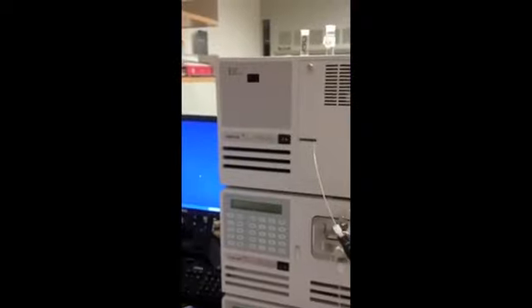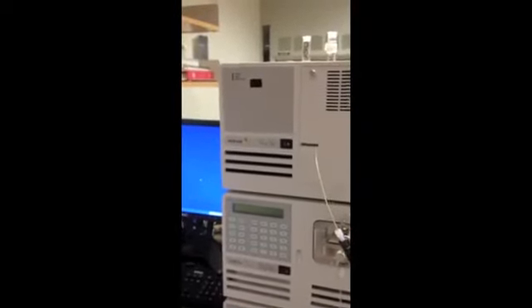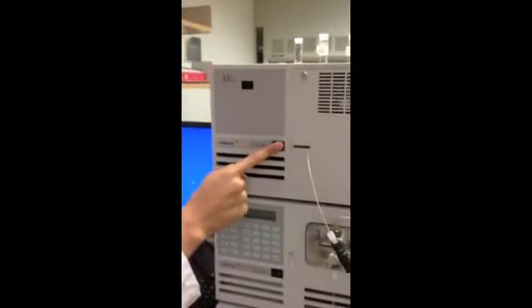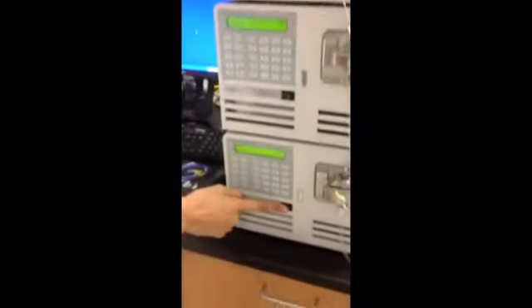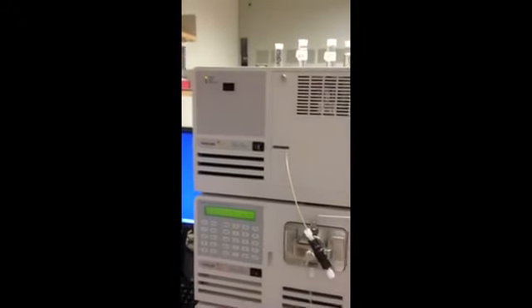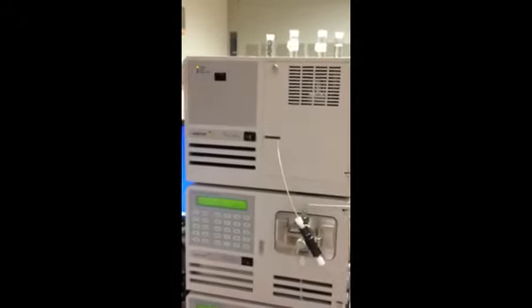We are going to turn on the HPLC machine. First, you turn on the detector, first pump, second pump. As it's getting warmed up, you're going to hear a couple funky noises. It's just warming up right now.